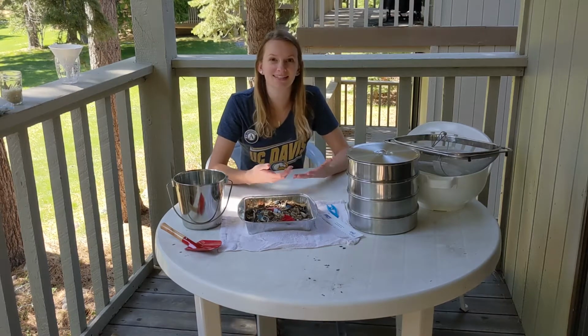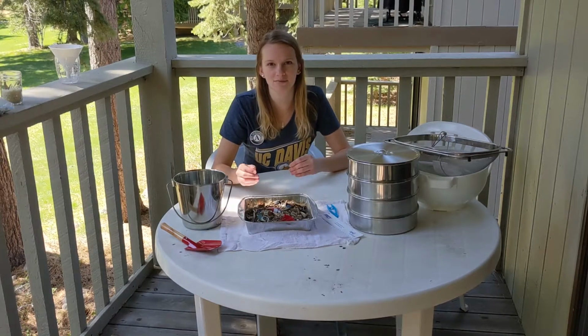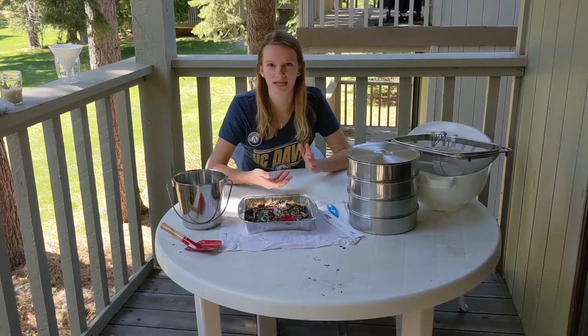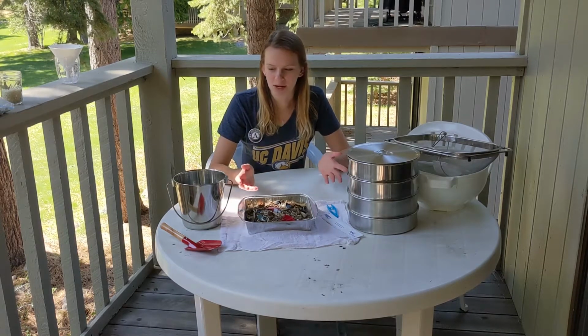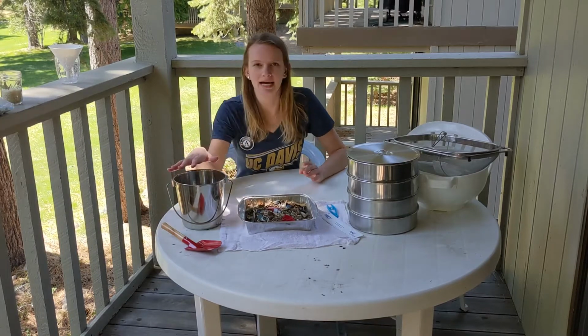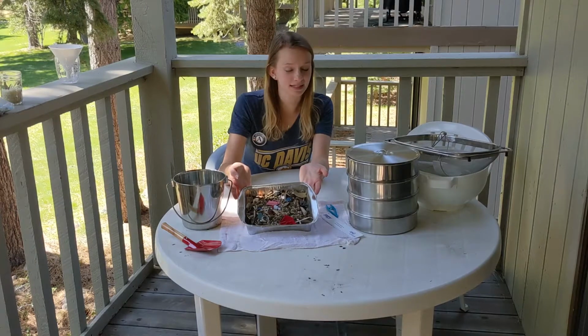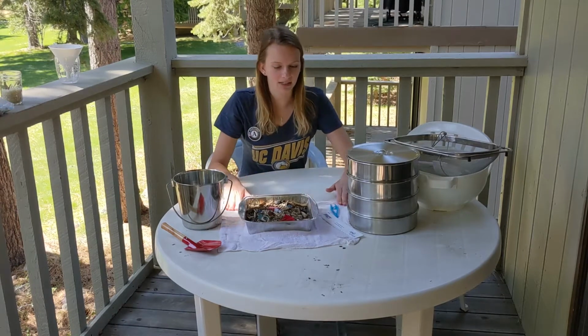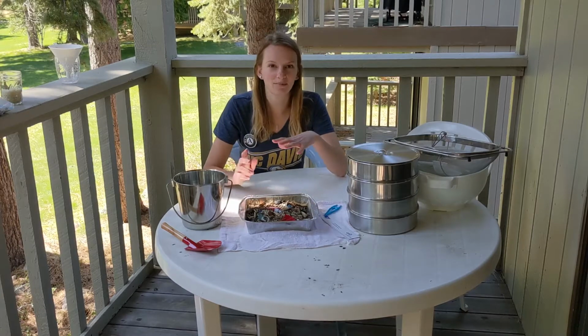So today we're going to conduct an experiment to investigate the different size of pieces of plastic that you might find in a beach sand sample from a nearby area. What you might need for this experiment will be a shovel and a bucket, and your sample will look something like this once you've collected it. You'll also need a ruler and some tweezers once you start sorting it out by size.